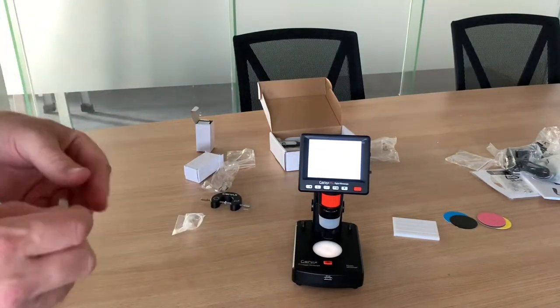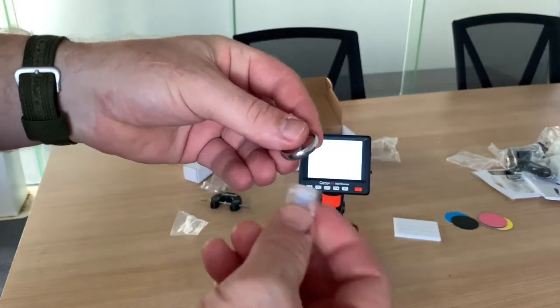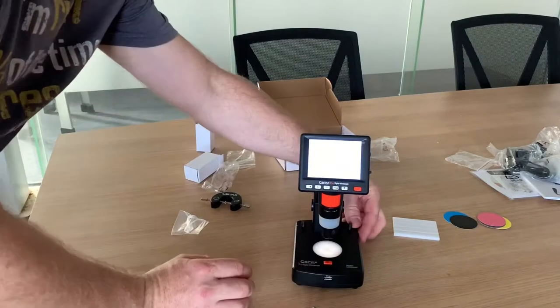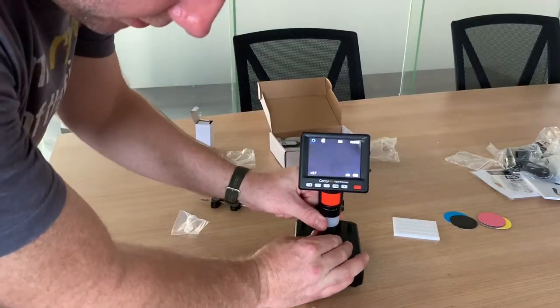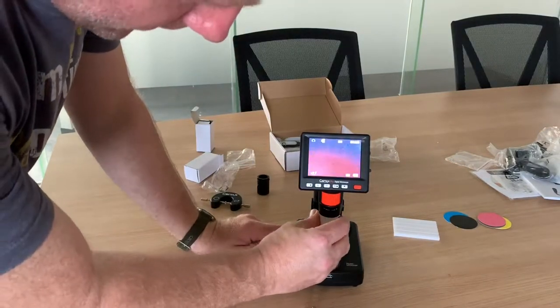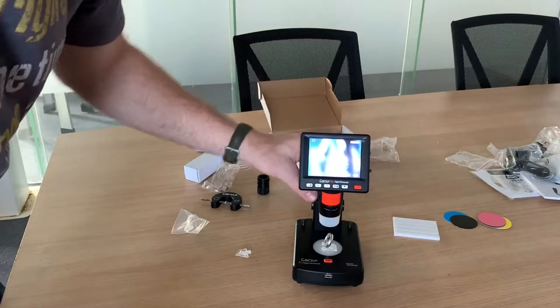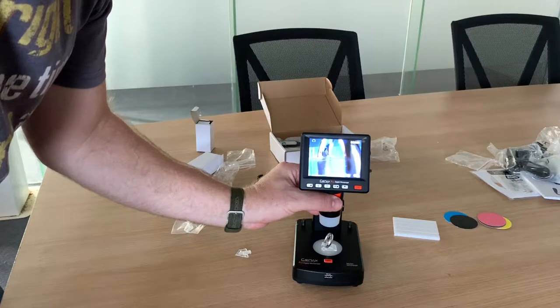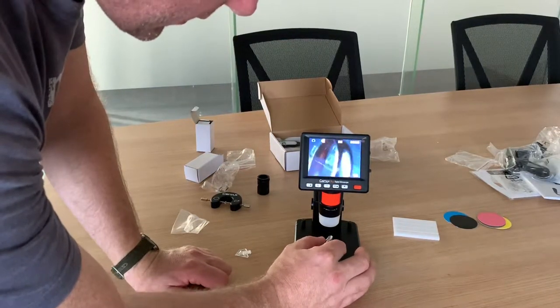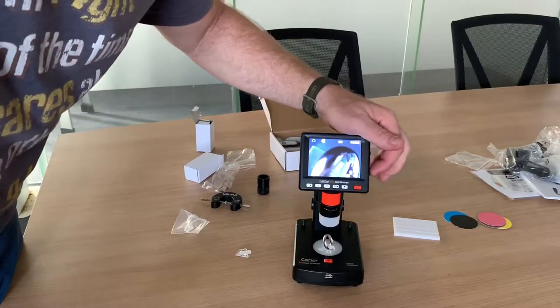It also comes with ring holders. Grab a ring - I don't have a diamond here but just to give you a quick demonstration. This just slips under here to hold your ring. If you've been looking at an inscription, remember to take out the extra lens by holding the white piece - it comes out for cleaning purposes and has a little groove in the back that has to be in the back position to insert it back in. Put your ring under there, take the zoom away first, then focus. Somewhere in this ring I know there's an inscription - there it is, you can see that.